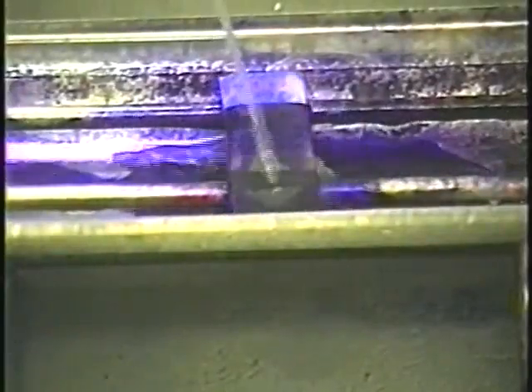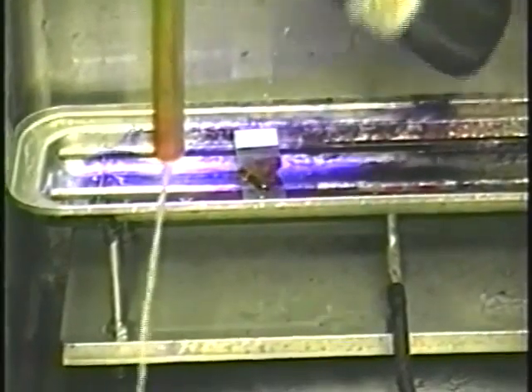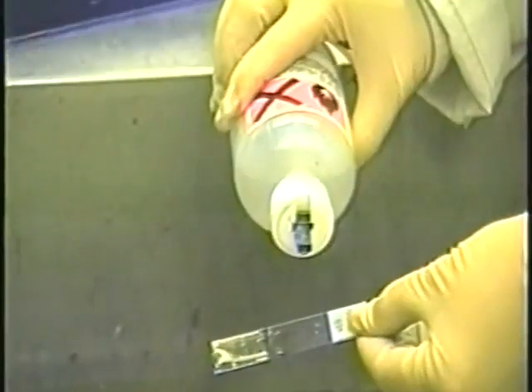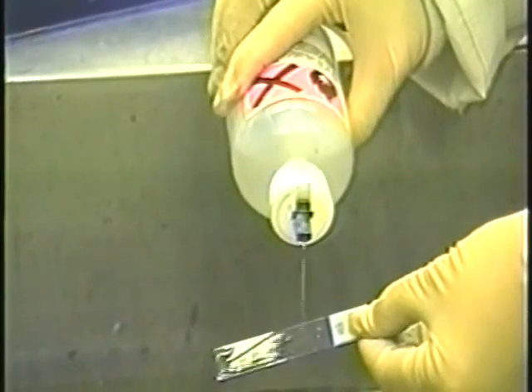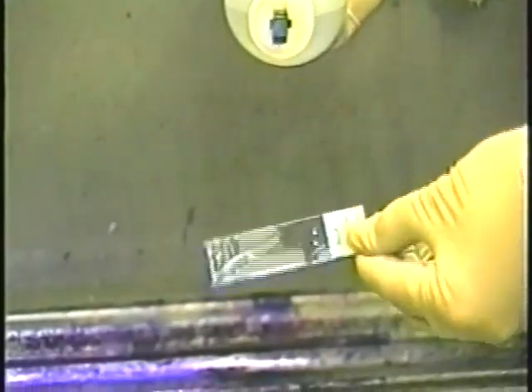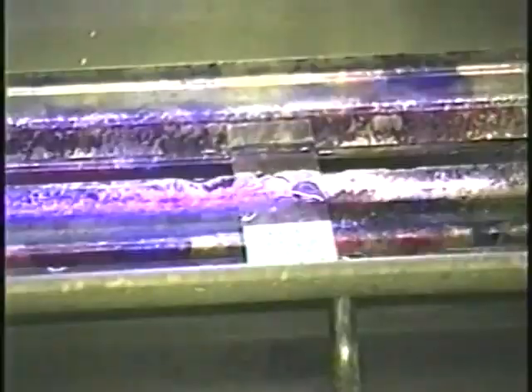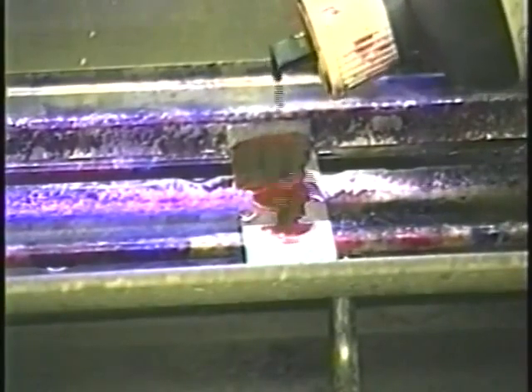First, flood the slide with crystal violet dye for 30 to 60 seconds. Drain the slide and rinse with tap water, then flood with iodine for 30 seconds. Drain and rinse the slide again, then carefully decolorize with an acetone alcohol solution by adding 1 drop at a time until the solution runs clear. Rinse to stop decolorization and counterstain with safranin for 30 seconds. After a final rinse, gently blot the slide and allow it to air dry.